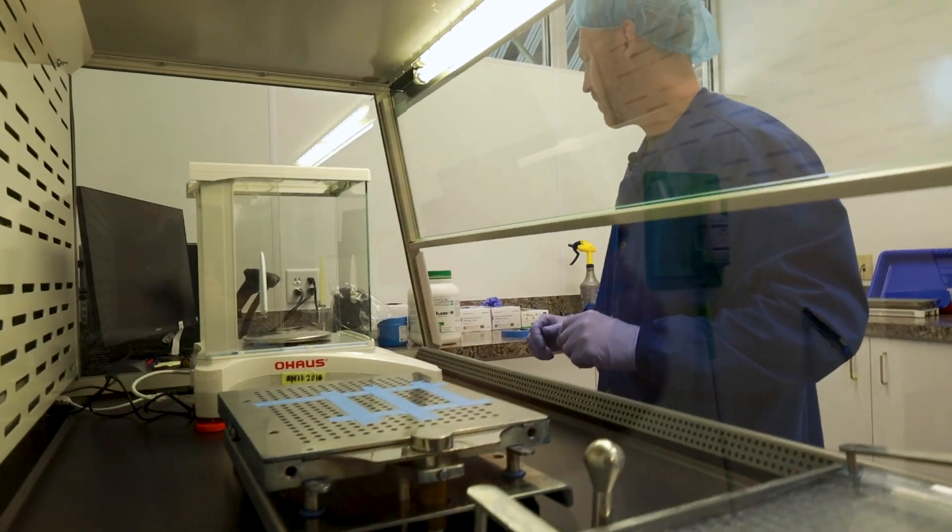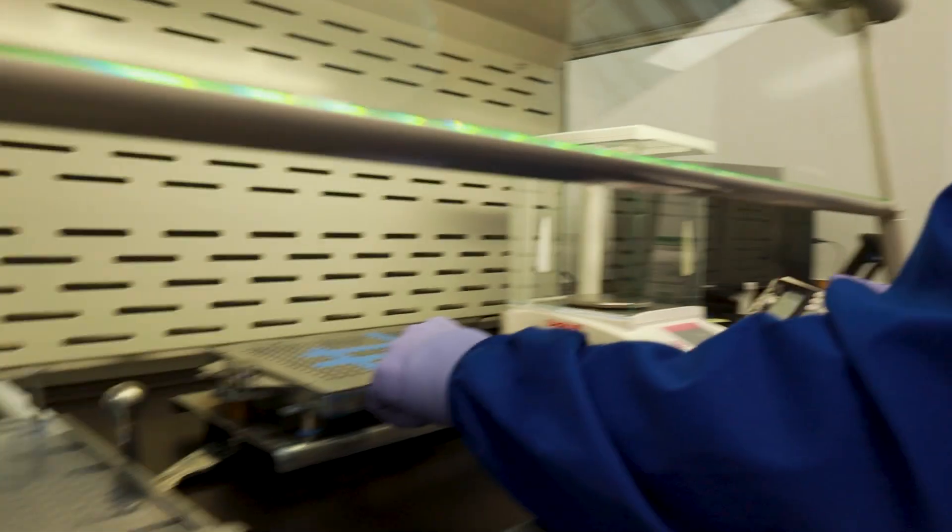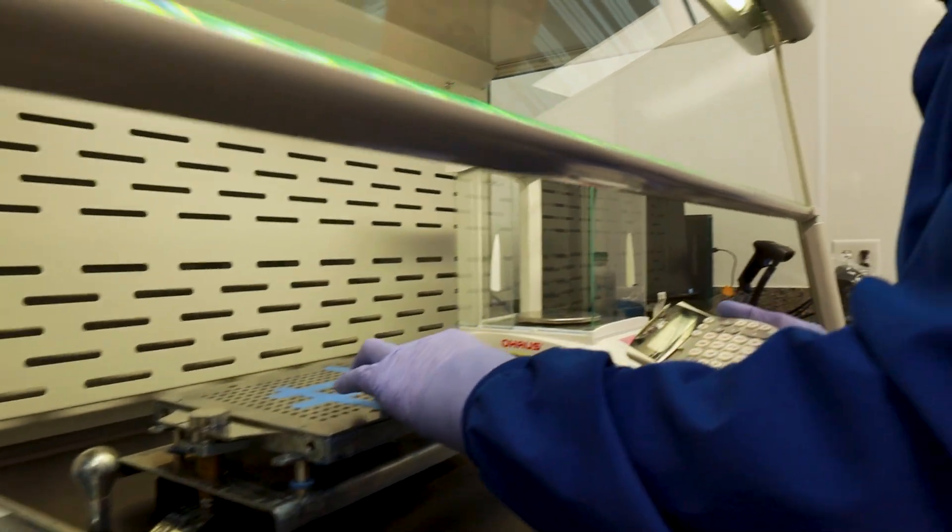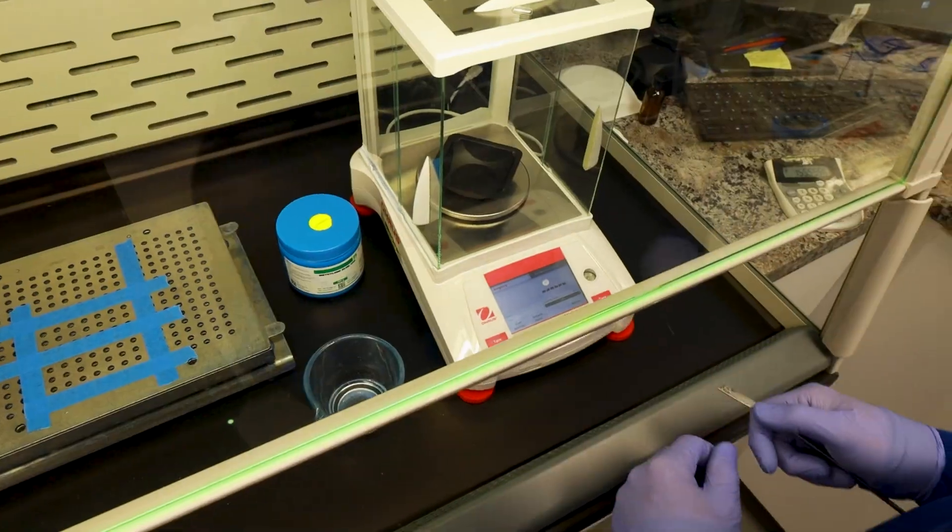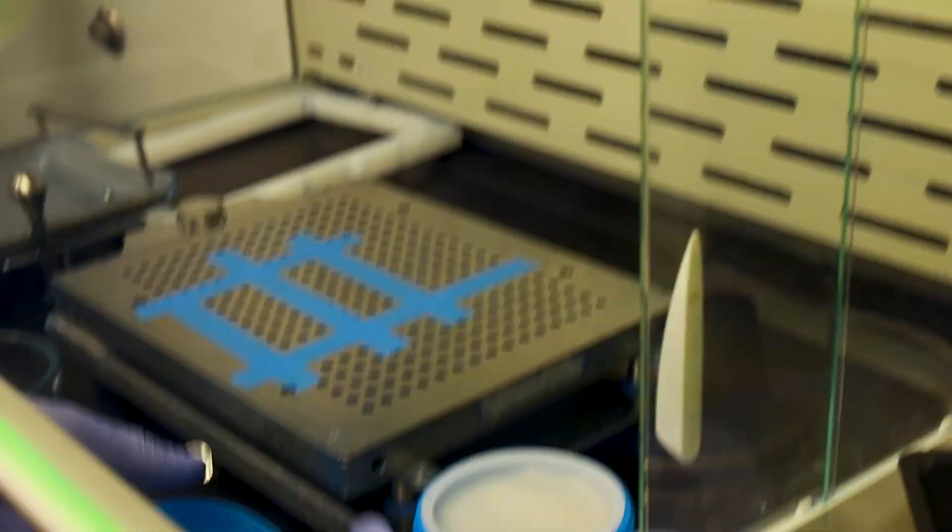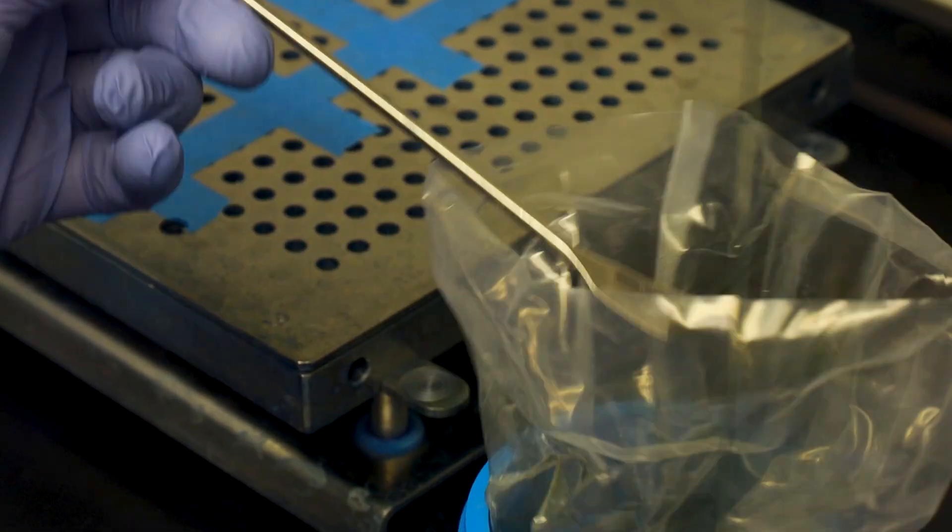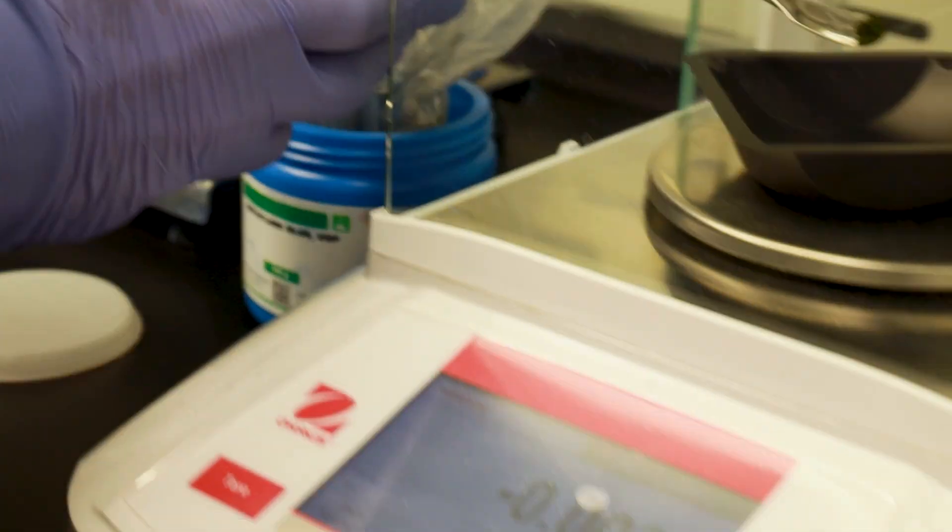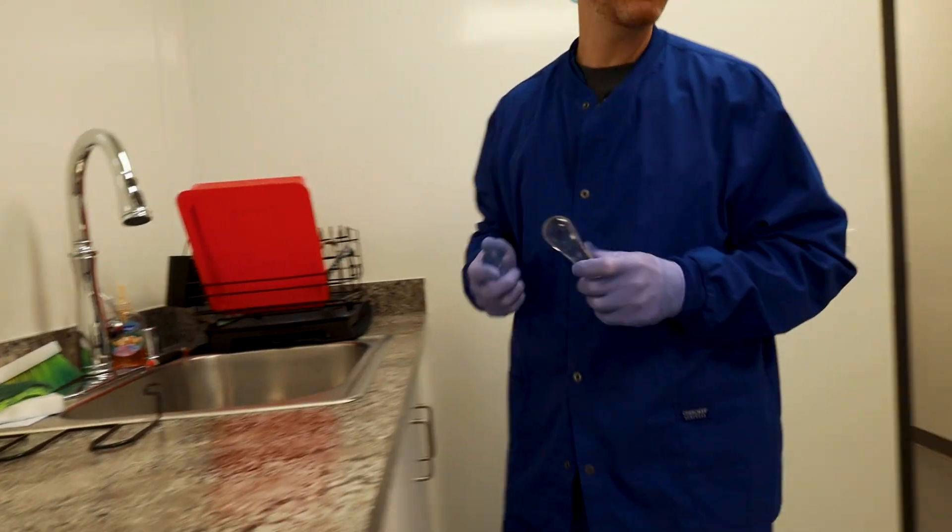Let's start weighing some stuff out, so I'm going to do some quick math. We're going to make 10 milligram capsules times 24. Spatula, spatula, spatula. The size of your mortar and pestle matter, I'm sure you've heard that before. That one's too big.